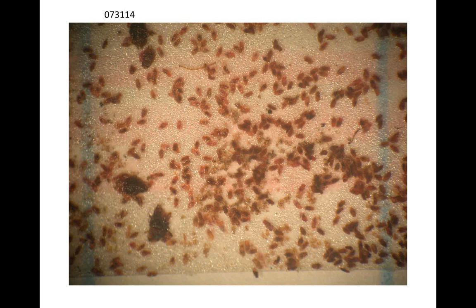So John, you didn't attempt to count the big ones, right? I counted if it crawled on the tape and got stuck, it was counted as an immature. So the 4 clusters were counted as 4. They're not clusters at all, they're just larger groups. Right. So those are counted as 1, 2, 3, and 4, right along with the others.